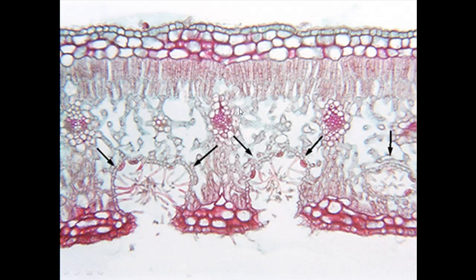Alright, we've got our veins here, so bundle sheath cells, xylem and phloem. Can't really necessarily see xylem and phloem separately. I'm guessing the xylem are at the top there. I can just make out some little circles, and at the bottom I can't at all, so that's probably phloem. But again, if you can't really make it out, draw the outside and label the whole thing a vein. If it's getting too small to differentiate the parts between the xylem and phloem, then don't, and just draw the whole thing as the vein. You can probably just make it out, so xylem here, phloem here, maybe here it's a little bit clearer, xylem, phloem, probably just under there, more a smile shape.